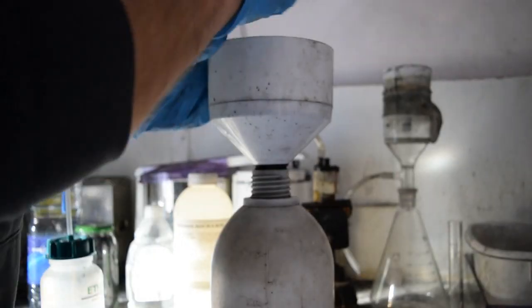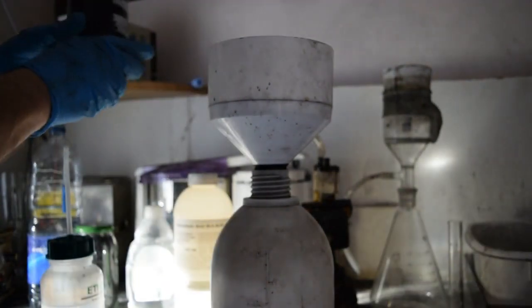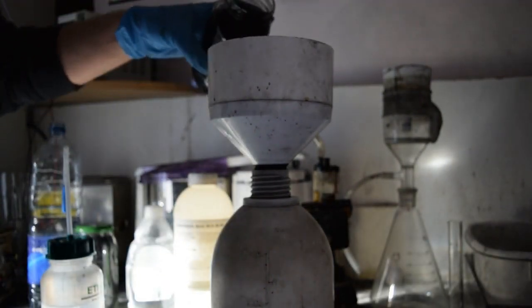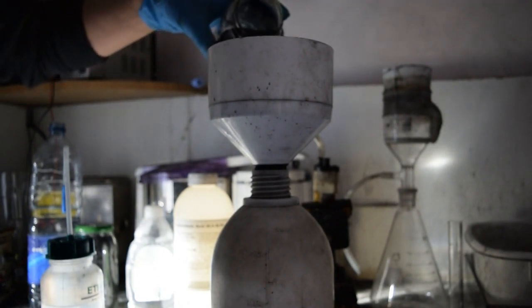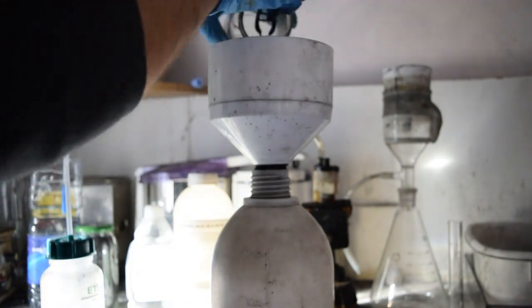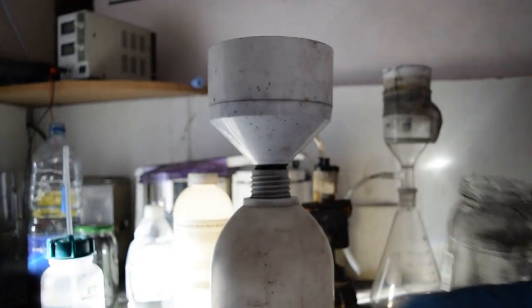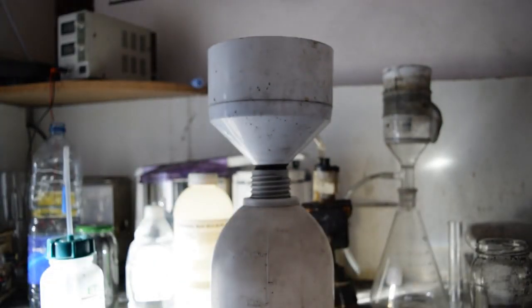I decided to do a voiceover on this bit so you don't have to hear the noise of the pump. Once you've got it well and truly stirred, then with the vacuum pump on, we pour in the carbon and got some tweezers ready to grab hold of the stir bar. I'll speed up the film a little bit for you and wait for all of the water with all the salts to disappear.